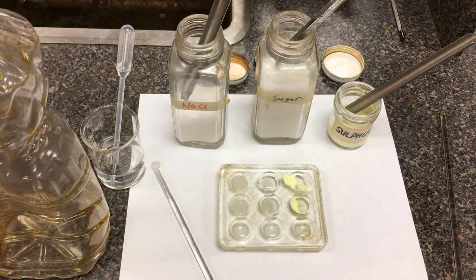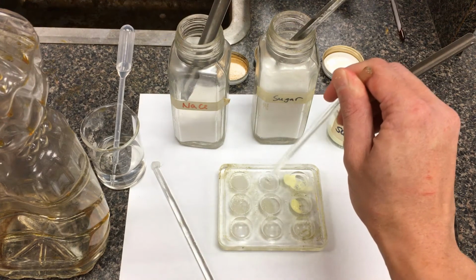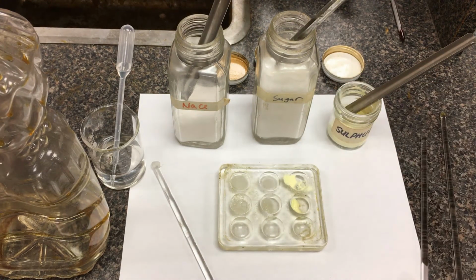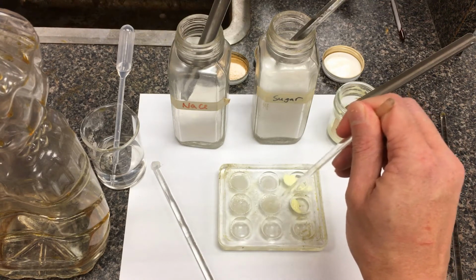Moving on to our middle solutions here, we have a sugar solution in water. Okay. Again, should be unsurprising to you here. Does sugar dissolve in water? Okay. And then similarly, we're going to be testing sugar in an oil solution. So very similar effect to what we saw with the salt.